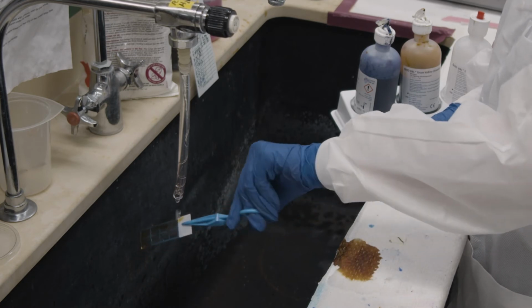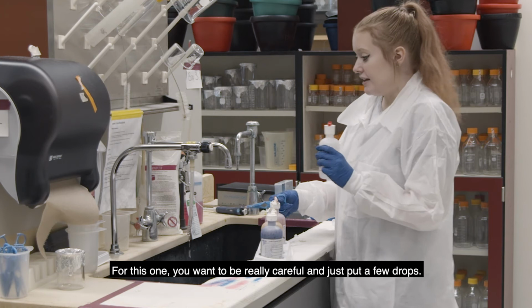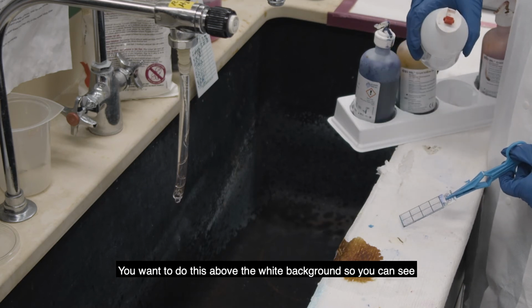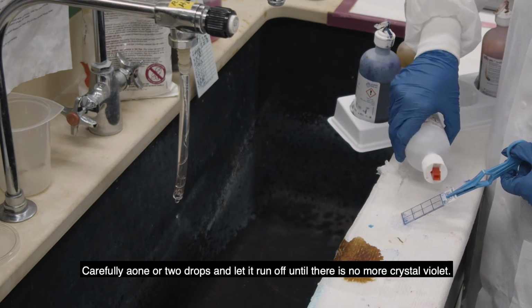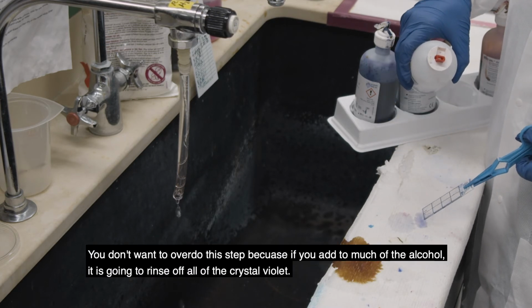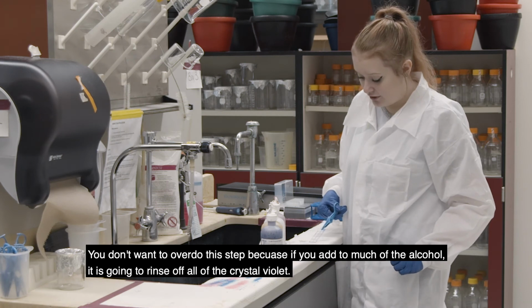And then once that is all rinsed off, we're going to use the alcohol destaining. So this one you want to be really careful and just put a few drops, and you want to do this above the white background so you can see. So just carefully add 1 or 2 drops and let it run off until there's no more crystal violet. And you don't want to overdo this step, because if you add too much of the alcohol, then it's just going to rinse off all the crystal violet, which is not fine.